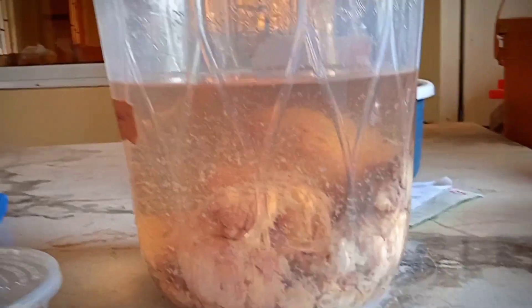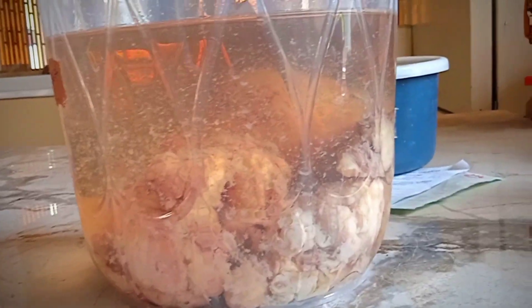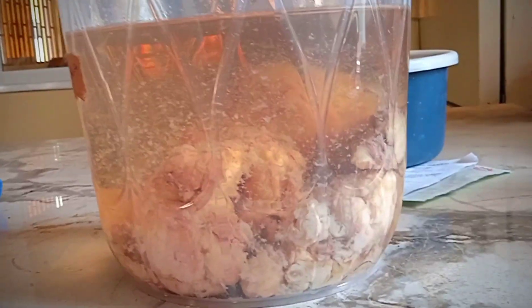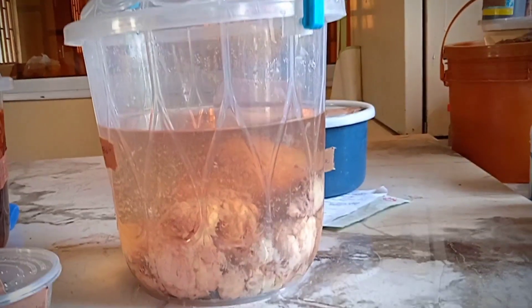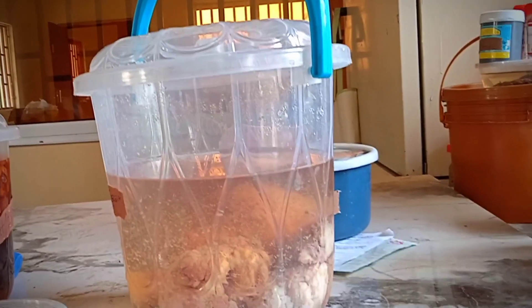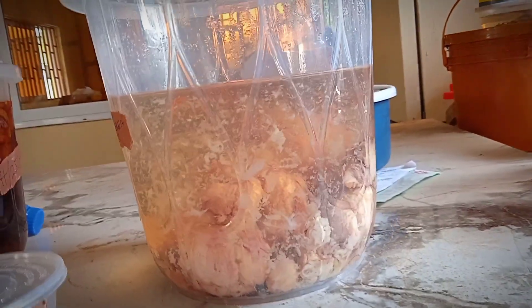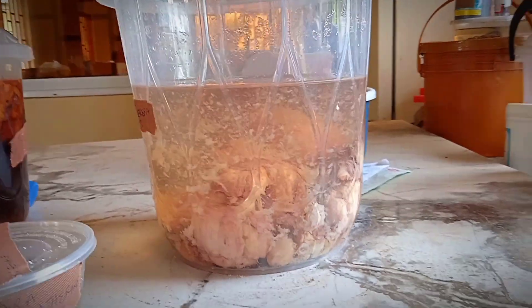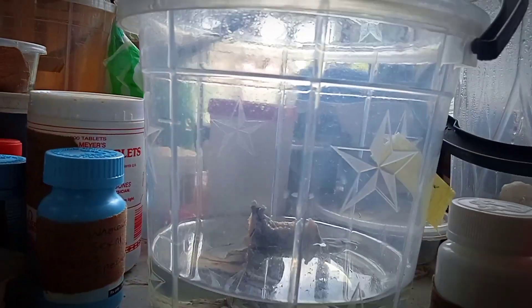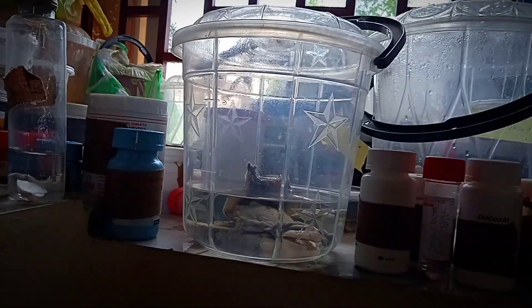These are different samples that we can see here — this is a fibrous tissue, there is also the breast tissue, and there are different ovarian cysts and all that present in this histopathology laboratory. All of them undergo various processes to help diagnose certain things like breast cancer and other diseases.